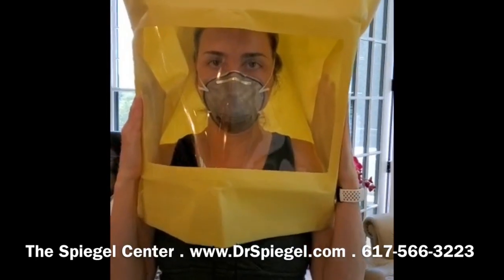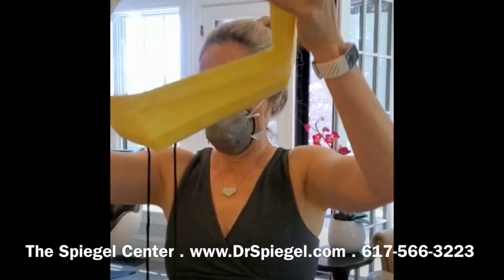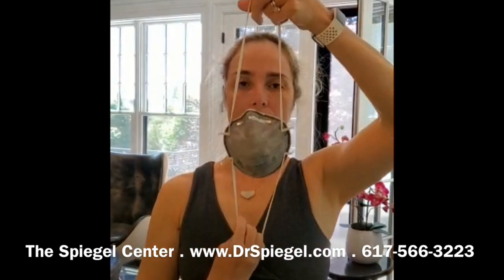If the subject has not tasted it at all, then their mask is a good fit. You can then take the hood off and remove your mask appropriately without touching the mask. You touch the lower strap first, pull it down over your face and hold it down, then remove the upper strap and take it off. This is the safe way to remove your respirator mask. Thank you.